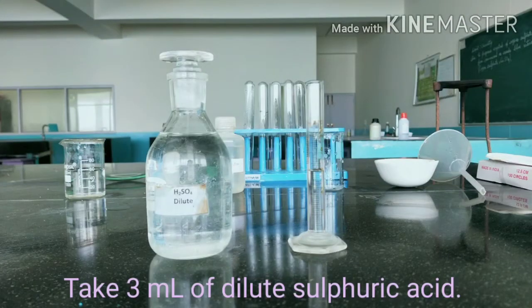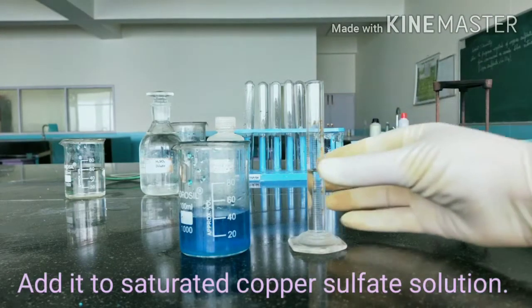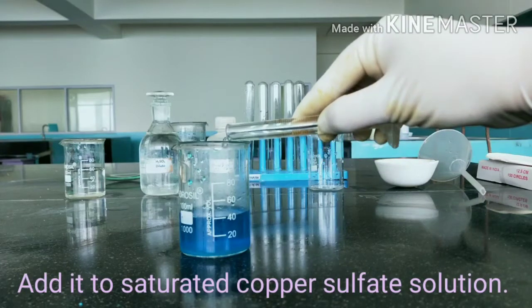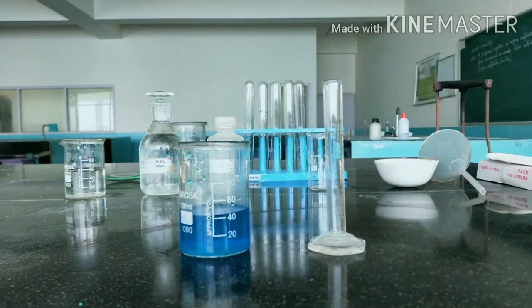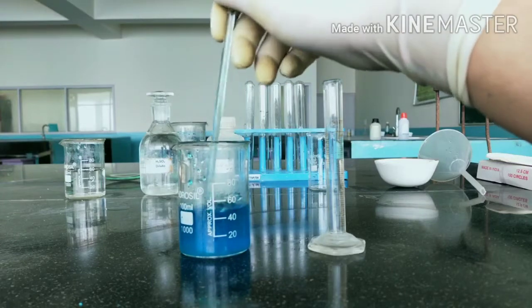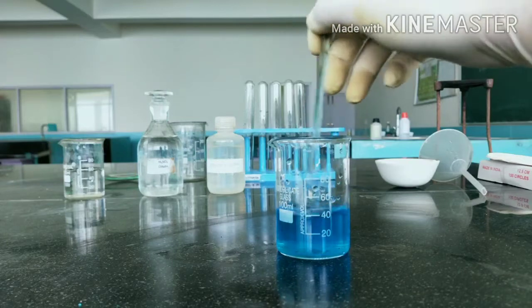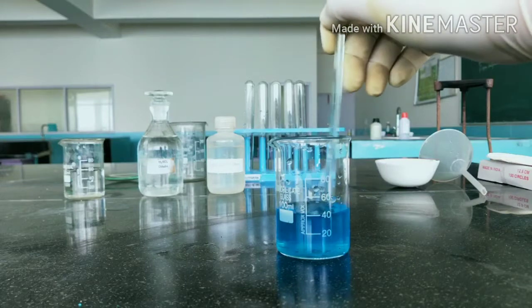Now we will take 2 to 3 ml of dilute sulfuric acid in a measuring cylinder and then add it to the saturated copper sulphate aqueous solution. And mix it with the help of glass rod. It is mixed until the solution becomes clear.